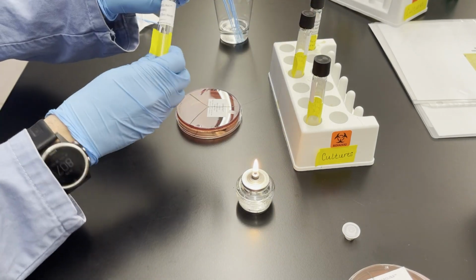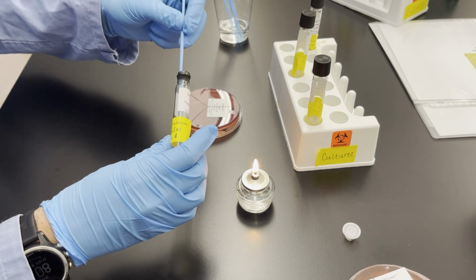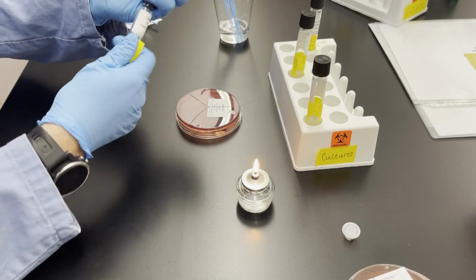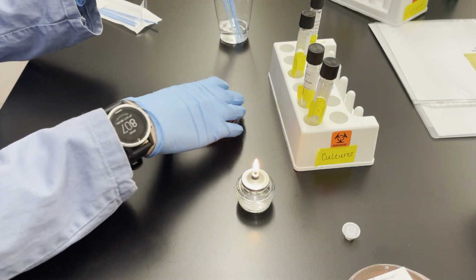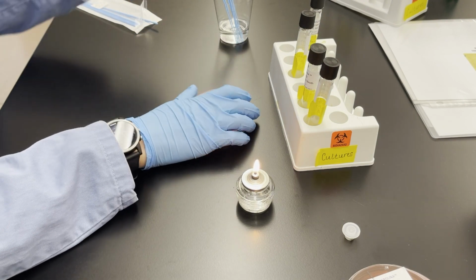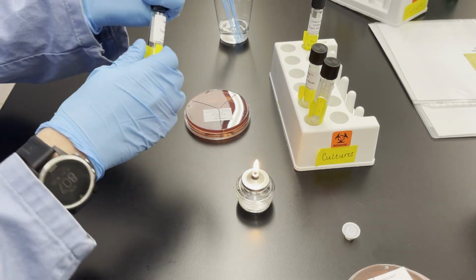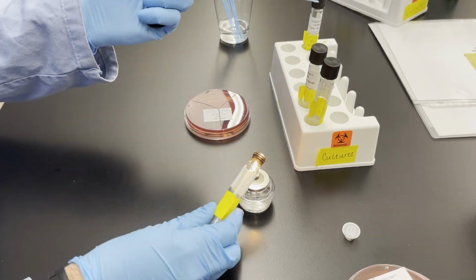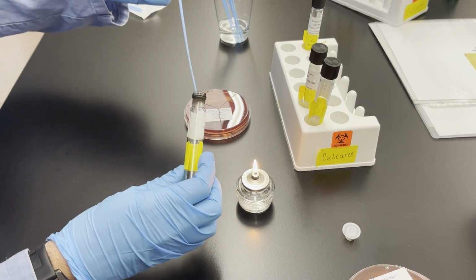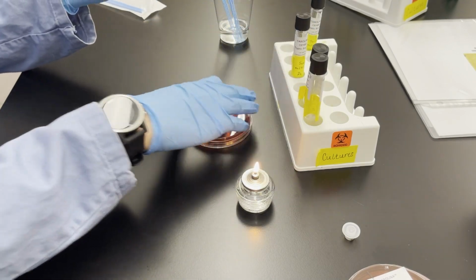This is the micrococcal culture. So flame the tube, grab a loop full of inoculum of micrococcus, flame the tube prior to closing it, put that down and inoculate the second region, which is micrococcus. And the third and final bacteria is staphylococcus. So same procedure. Again, just double check you're putting the bacteria in the proper section on the plate. So when you see growth, you can be confident that it is the bacteria because you double and triple checked that that was the area.